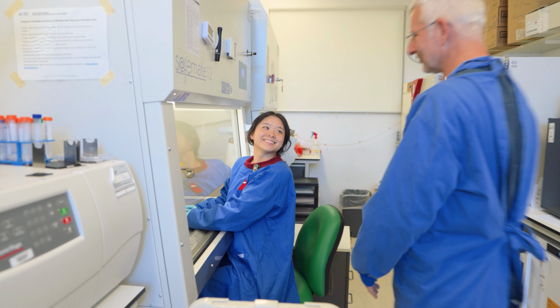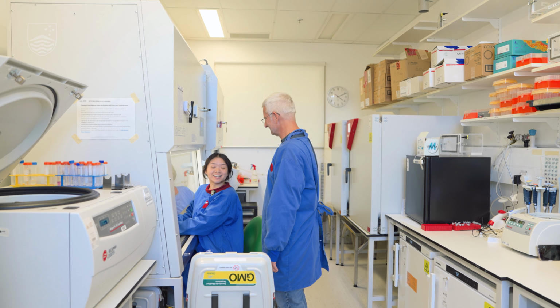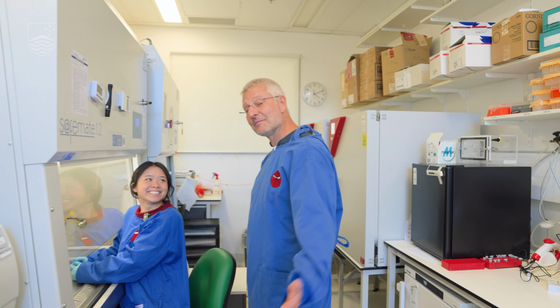Hi Cecilia, how did you go? Good. I managed to separate the infected from the uninfected red blood cells, which means that I can move on to the next stage of my experiment. That's terrific. One of the problems we have is that the parasites we have encountered so far are all microscopic, so we always need a microscope to look at them. Now we will look at a parasite within a parasite.